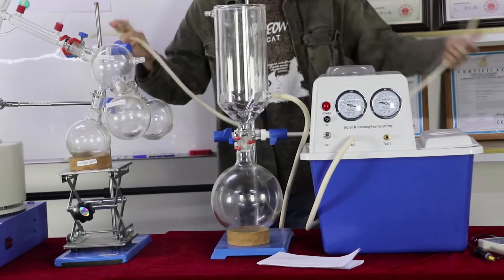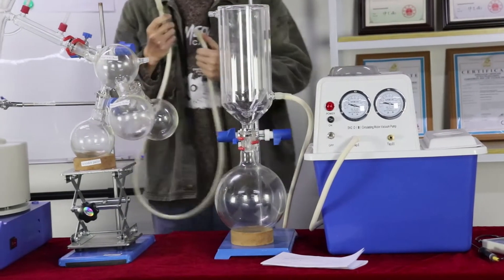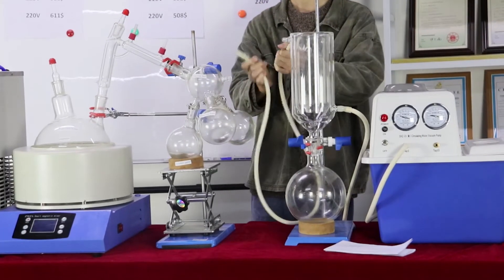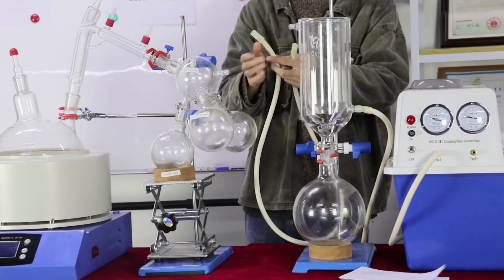Second, I need to connect the cold trap to the 4-way bottle.